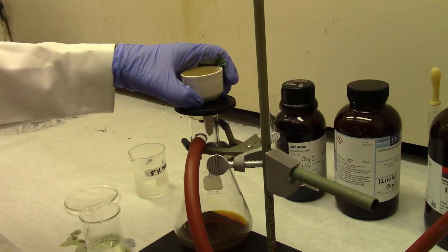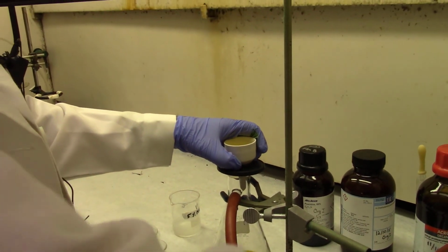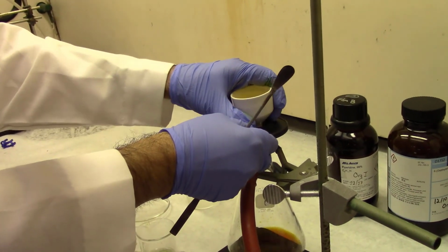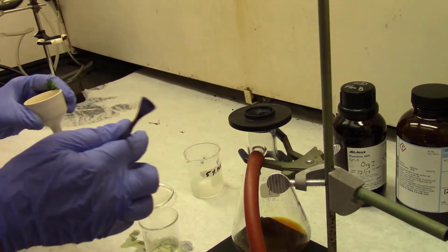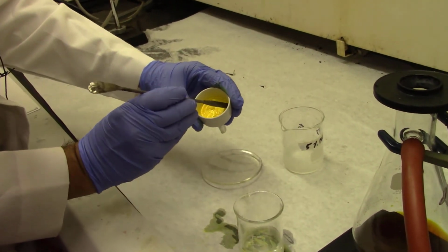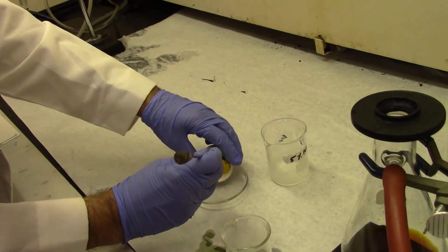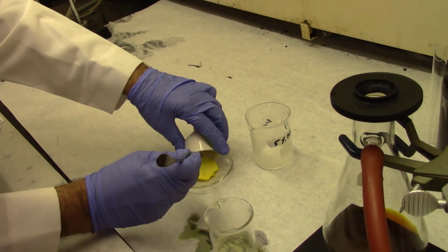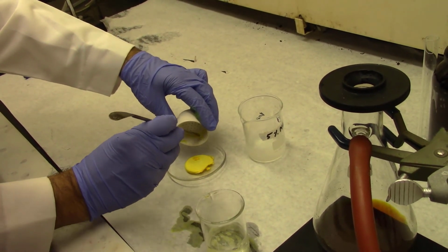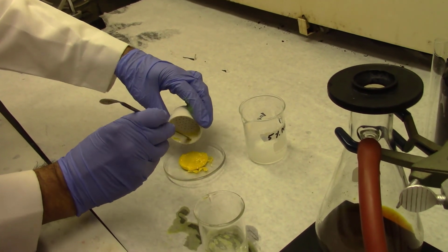And you can imagine that when they are excited, they will be giving out their own lasers by fluorescence. Okay, so you have basically synthesized the laser dye containing coumarin as an important part of the molecule. Transfer the whole thing, transfer your product as much as possible from the Buchner funnel onto the watch glass.